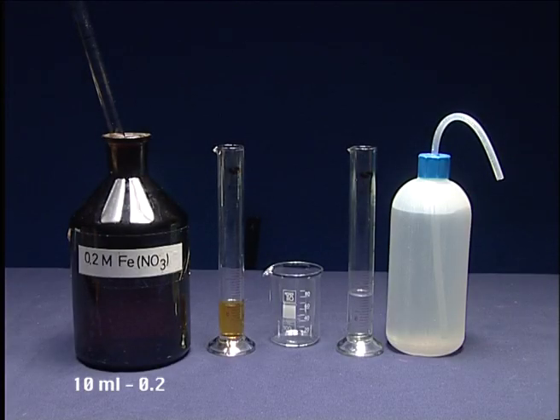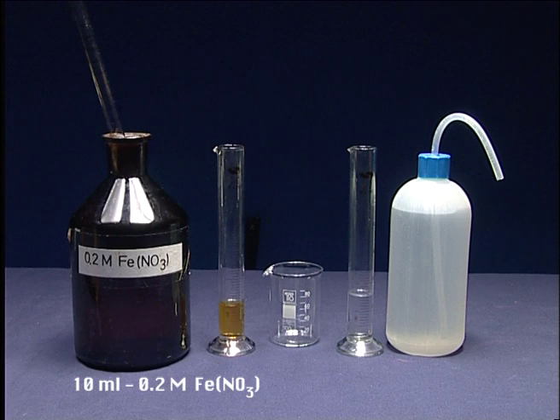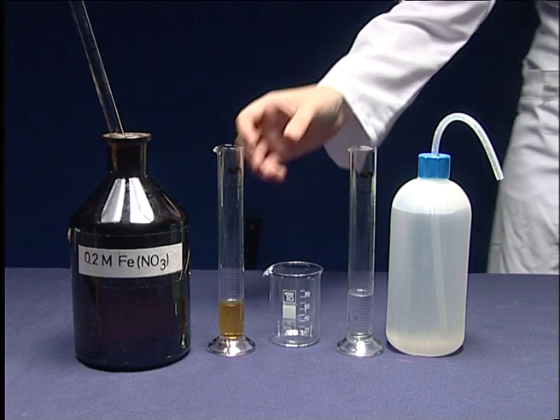Take 10 ml of 0.2M Ferric Nitrate and 15 ml of water, then put them into a beaker.